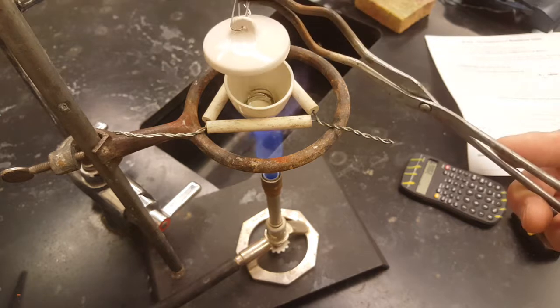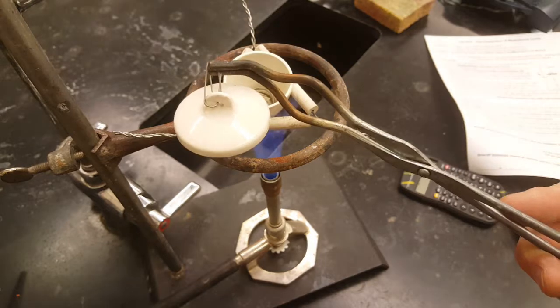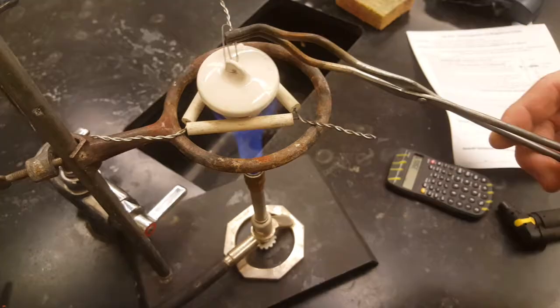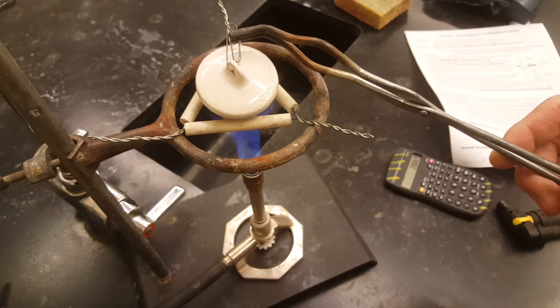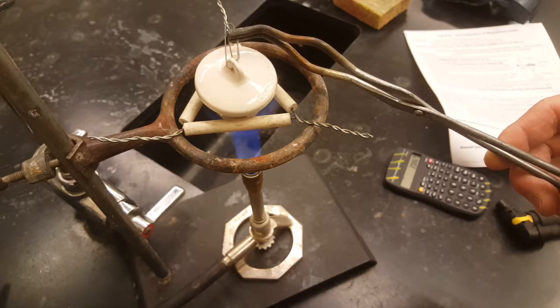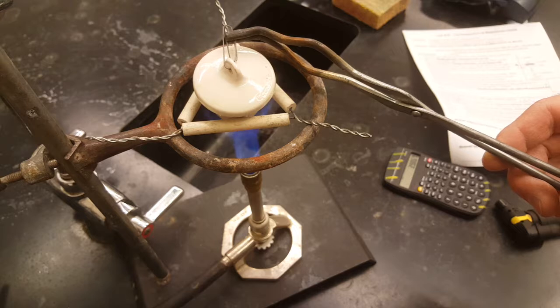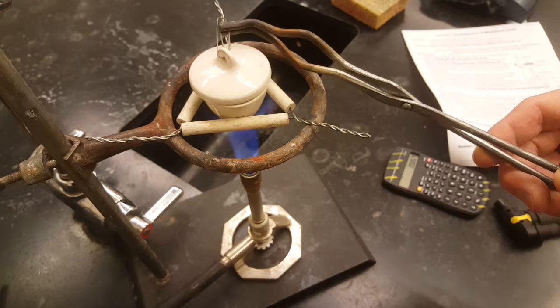Your reaction will start a little faster if you take the top completely off and just hold it there with your crucible tongs, waiting to see that magnesium start to glow. Now the magnesium starts to react really quickly, suddenly, and that's why you want to hold the top over. My magnesium suddenly began to react, and I just put my top all the way on the crucible. That restricts the oxygen flow and controls the rate of the reaction. We can take a peek and we can see the glowing magnesium inside.